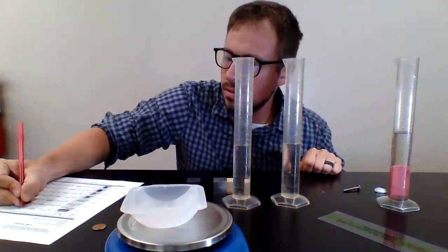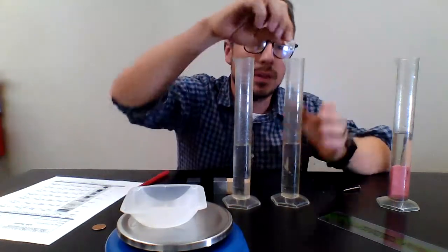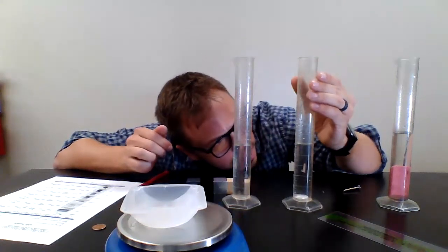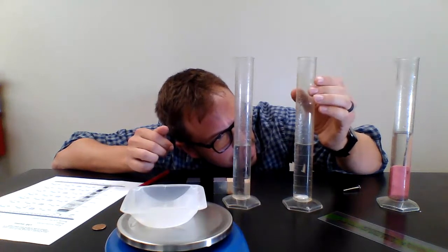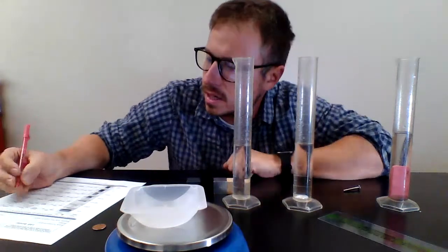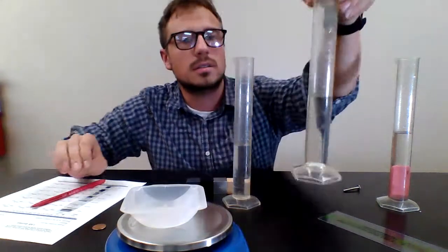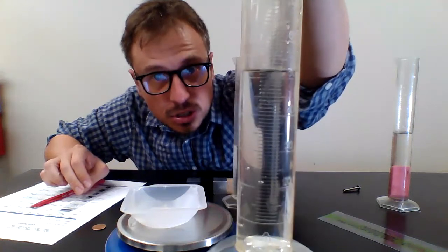Now I'm going to place that gemstone in one. I'm going to put my hand over it. There we go. If I look at that, it went up to about 50, I'm going to say 53. So it goes up to that 53. It started at 50, now it's up to 53. You can see that there. Remember, these all started out at 50.